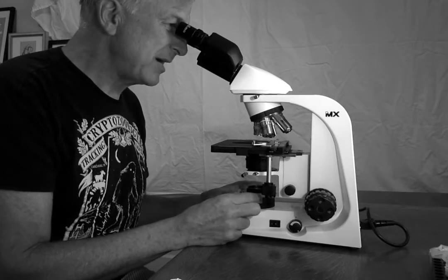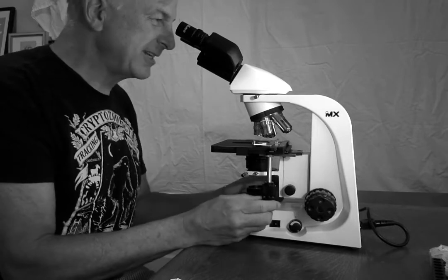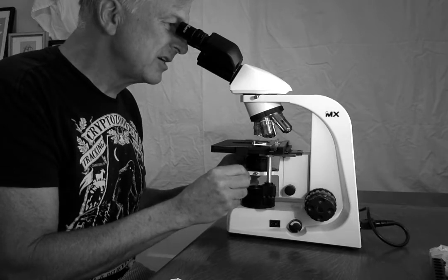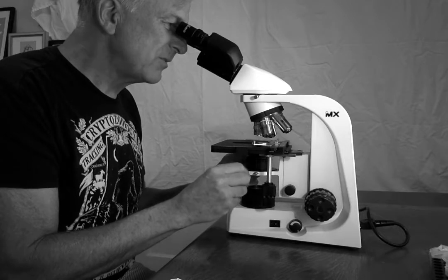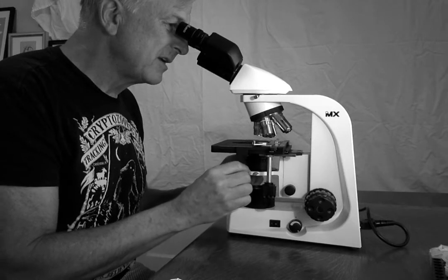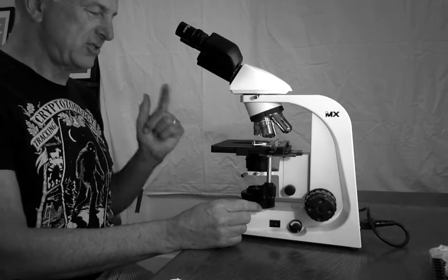Now I see a bright polygon of light with a little bit of a black border, and I can see, hey, I'm not quite in the center. So again, I'm going to use these adjustment screws and try and move that polygon around so that it's more centered. I've got to move to the left here and down a little. Now I'm going to open it a little more. And I think I'm centered. I think I'm good. I think it's sharp.